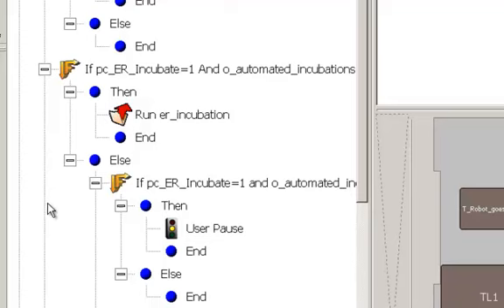And that's kind of how the method progresses from here. It's just a matter of a bunch of if statements. If it's set to a 1, you do it. If it's set to a 0, you don't. But when you're adding master mixes, it all calls that one procedure, add reagents, and it uses that same procedure to add all the reagents, whether we're adding the end repair, the ligase. And when you're doing the ampure, it calls that one ampure procedure.